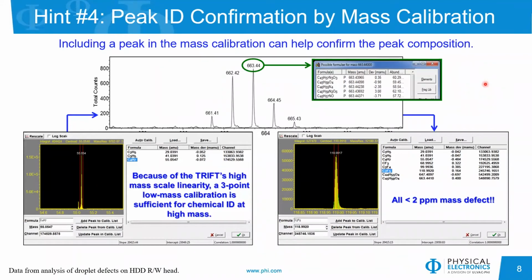So one thing that you can do in doing some of your peak assignments is using a properly calibrated mass spectrum to help look at some of your higher mass peaks. One of the things that I will often do is calibrate my mass spectrum using 3 peaks at low mass. And then often I will go up to some of the highest mass peaks that I see in my mass spectrum, and I will open up the peak ID tool. Based on the compositions that I see in that peak ID tool, I suspect what the composition might be. And if it is that composition, then I should be able to include that peak in my calibration, and the calibration will still stay quite good. If it is an incorrect peak assignment, it will cause your mass scale calibration to get worse.